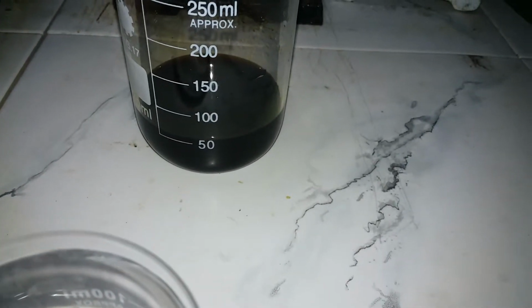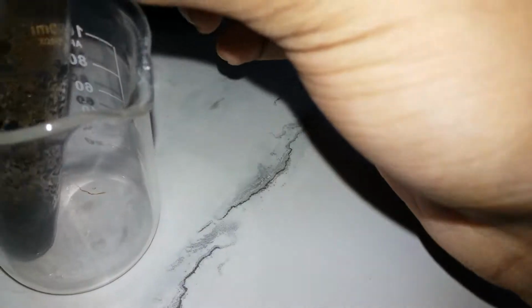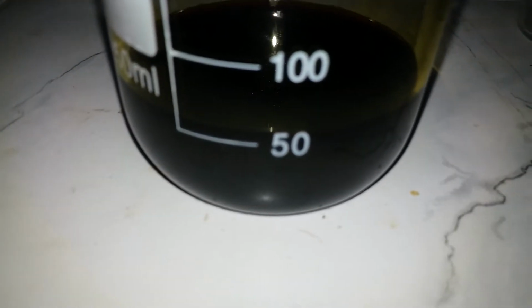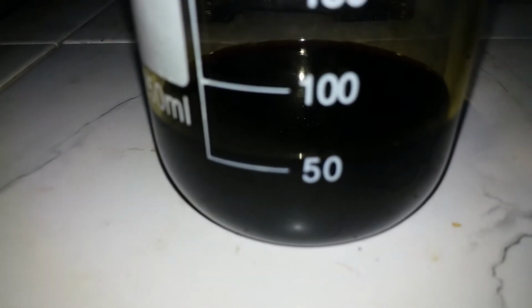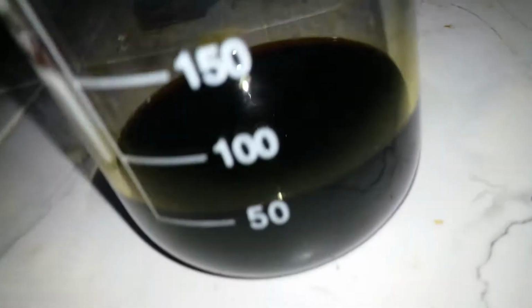And we're gonna give this more time. Well, I'm gonna come back later. Okay, so this is taking really long time to precipitate out, so I'm gonna continue this stuff in the second part. Wow, I can't speak. Okay, so the other thing I see is when I shine light on the other side of the beaker, I can see purple color.